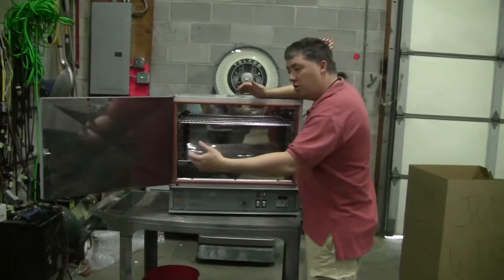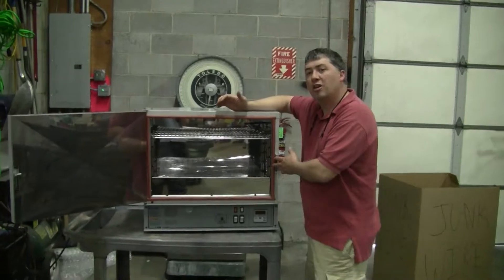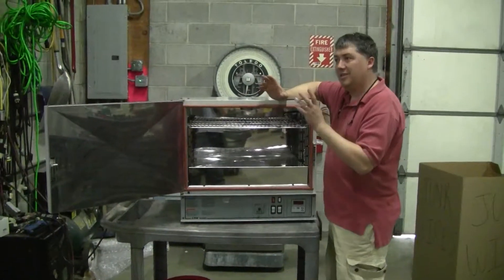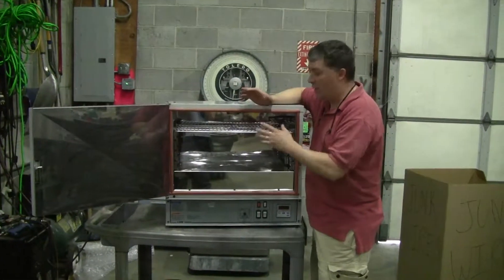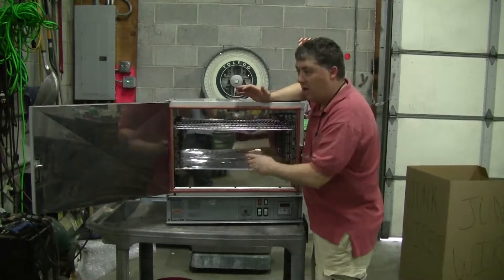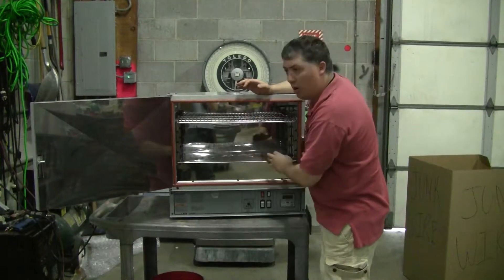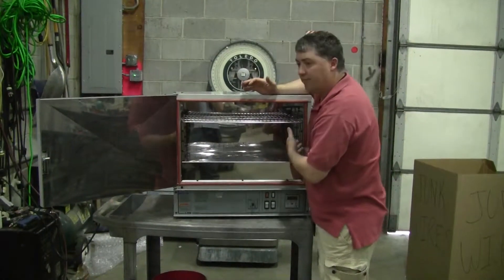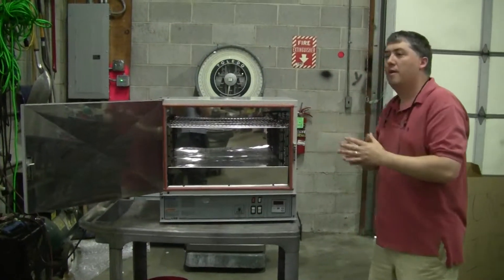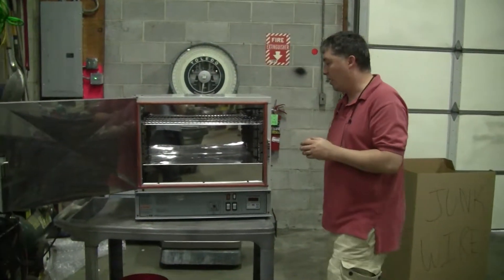When you open the door and then close the door on a mechanical convection oven, the time to get back to the equilibrium or the set point is going to be relatively short, because the heater is going to heat, the fan is going to blow the hot air, and that'll all nicely come together, bringing the oven to temperature quite quickly.